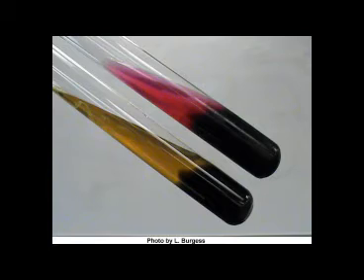In this case, the tube at the top is an example of reversion. However, it is H2S positive instead of negative. The tube on the bottom is acid-acid. Both the slant and the butt are acidic, and it is H2S positive.